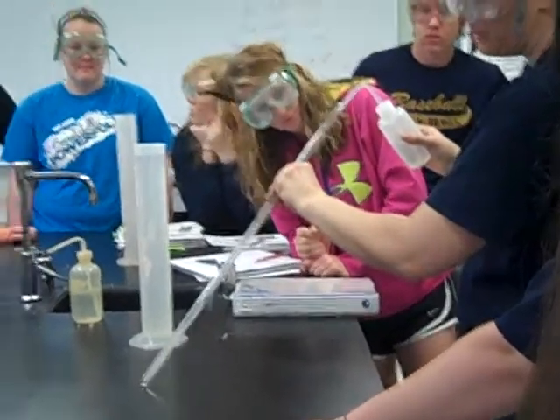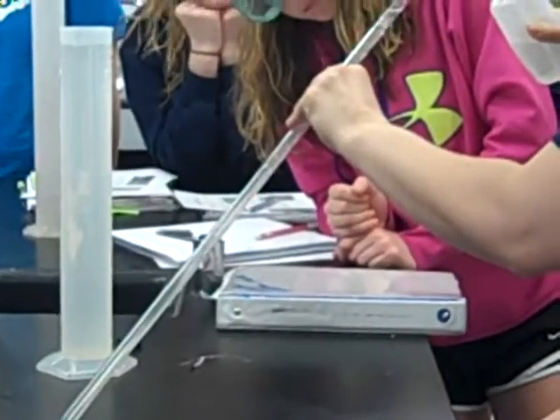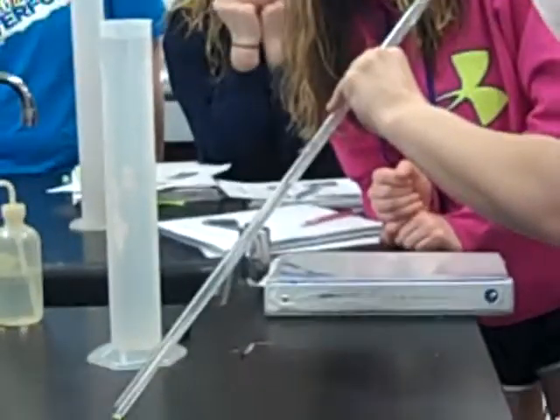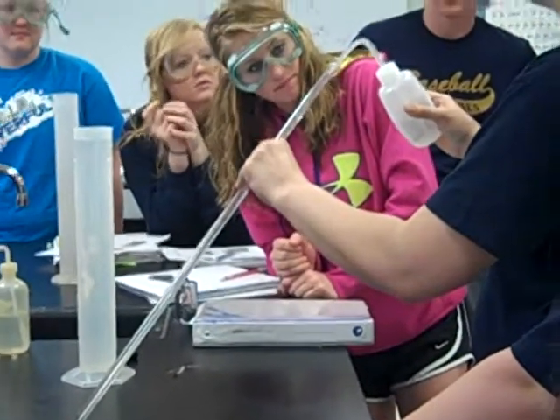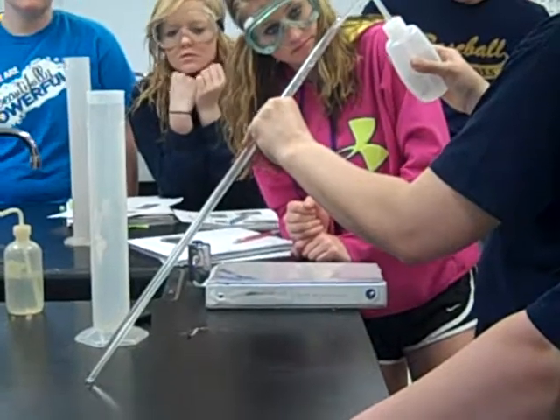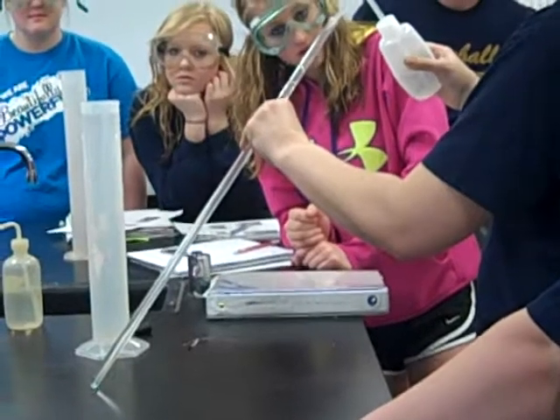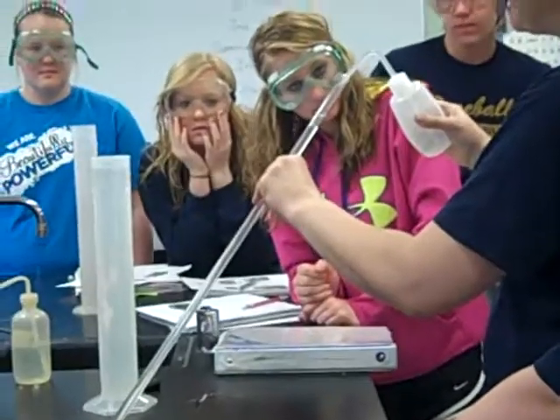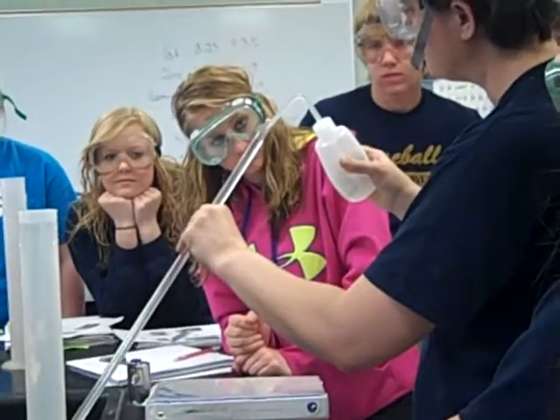You can see where it's mixing a little bit — you don't really want it to mix. You want the hydrochloric acid on the bottom. The molar mass of water is 18, and the molar mass of hydrochloric acid — well, chlorine is 37 — so it's a lot heavier. What we're doing is we're layering it using that density difference.